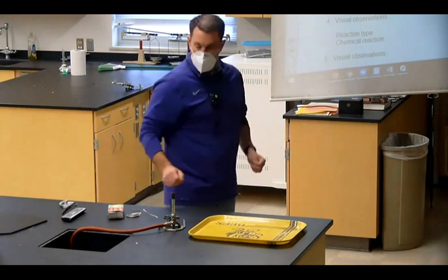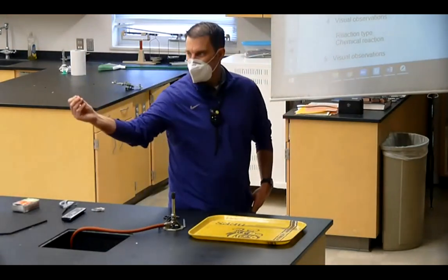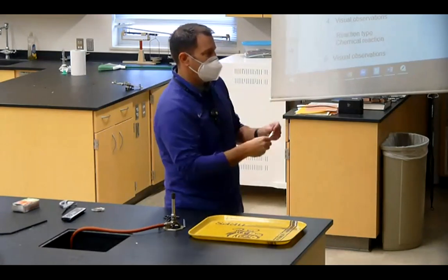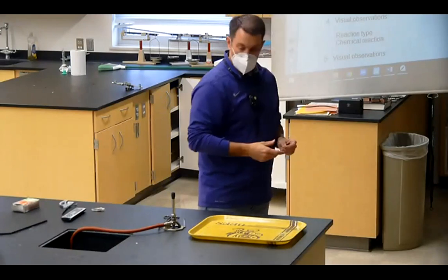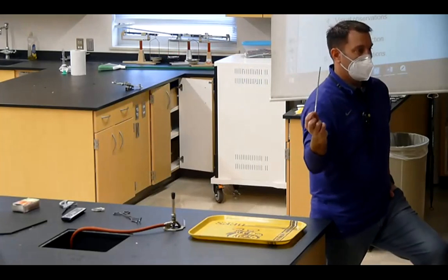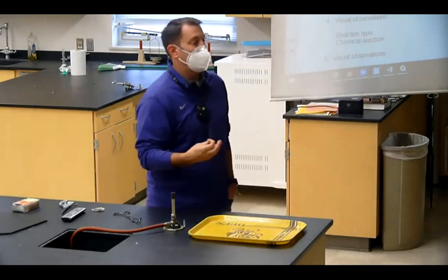All right, so in this reaction, I've already cut a piece. I have just a piece of magnesium, which is just this shiny metal. It's really thin. We've used it a lot in this class. It's really malleable. Just bent it right there. So we just have this one single piece of metal, which is magnesium. Now, I need to react it with oxygen. Where can I find oxygen? In the air. Now, I can let this just react for the next 2 years, and we can watch this process happen. But no one wants to do that, right? So I'm going to add heat. I'm going to light it on fire.